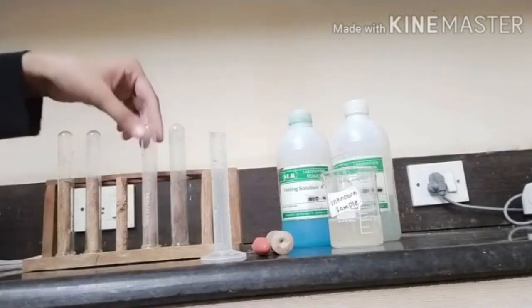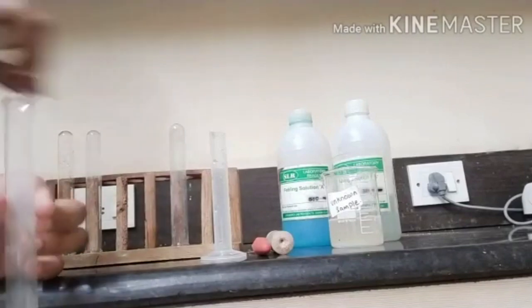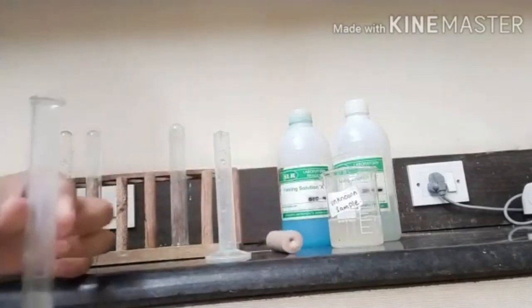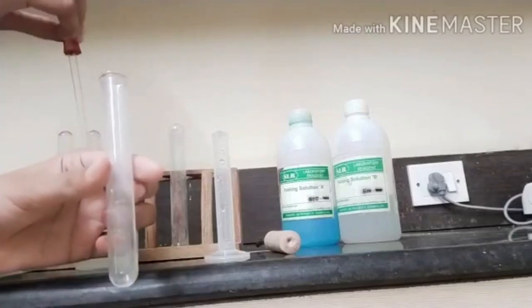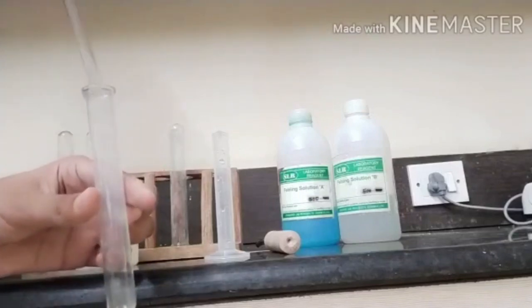First, we take a dry test tube and add with the help of dropper the unknown sample like this.